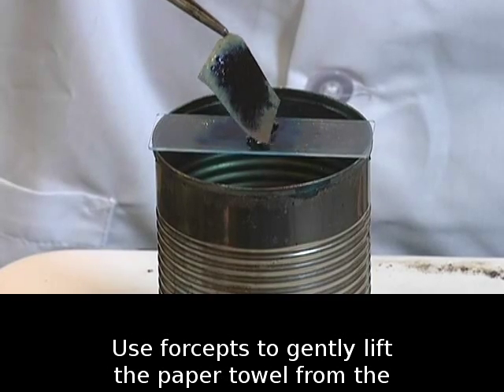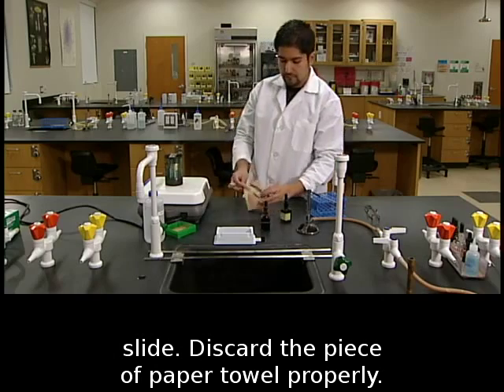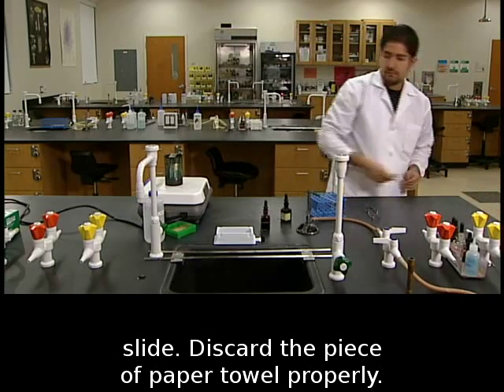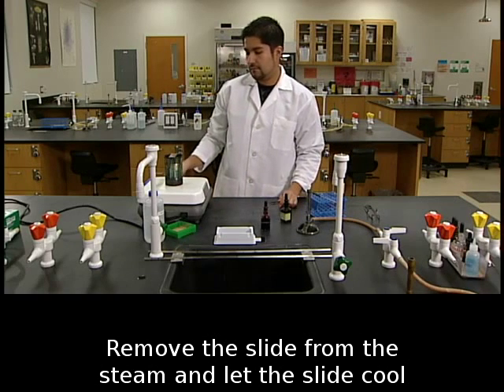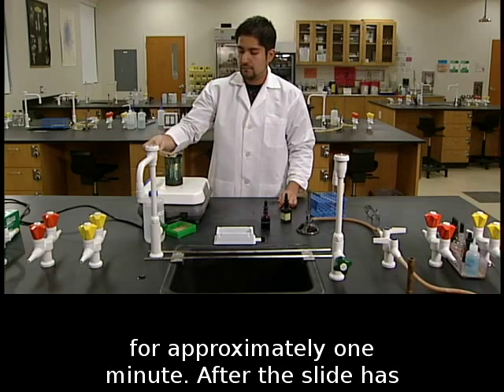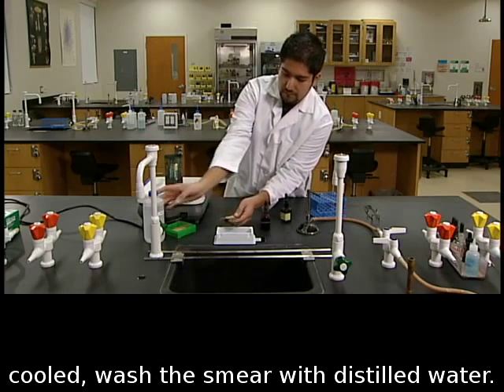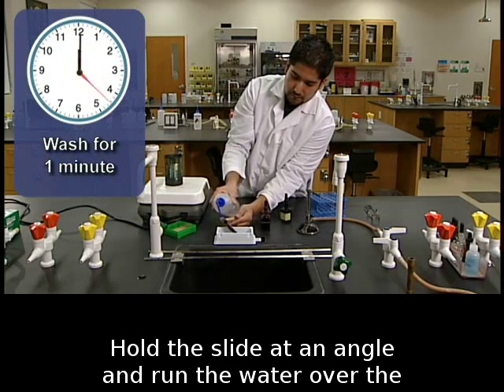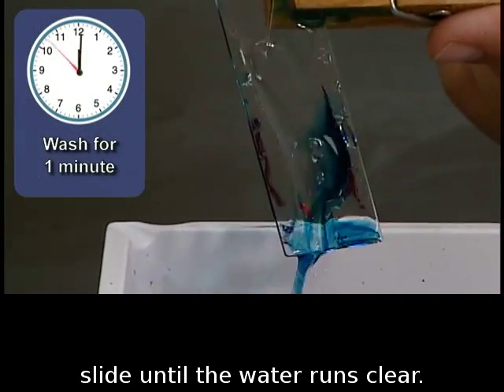Use forceps to gently lift the paper towel from the slide. Discard the piece of paper towel properly. Remove the slide from the steam and let the slide cool for approximately 1 minute. After the slide has cooled, wash the smear with distilled water. Hold the slide at an angle and run the water over the slide until the water runs clear.